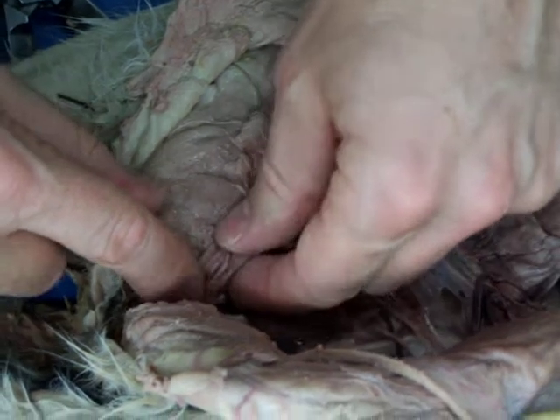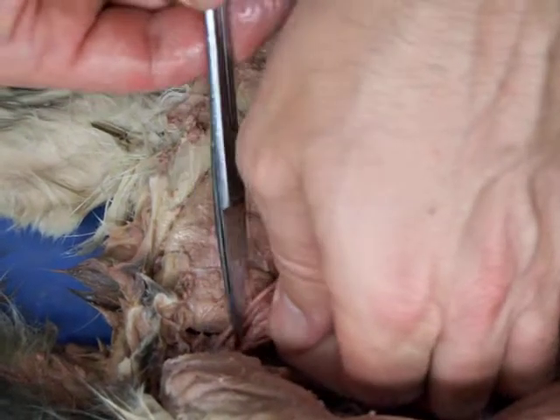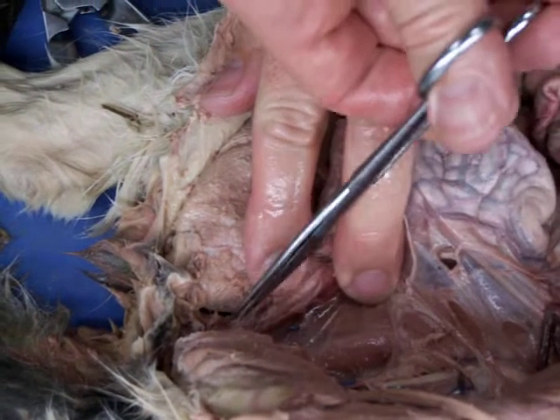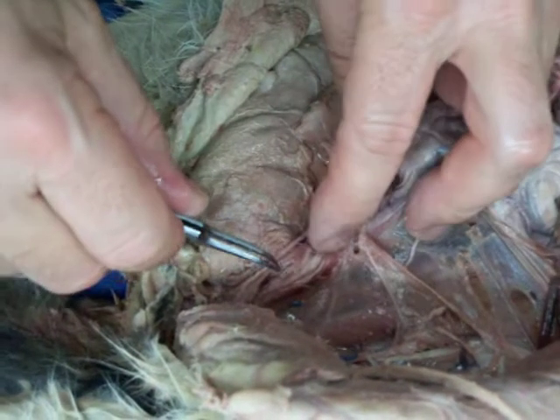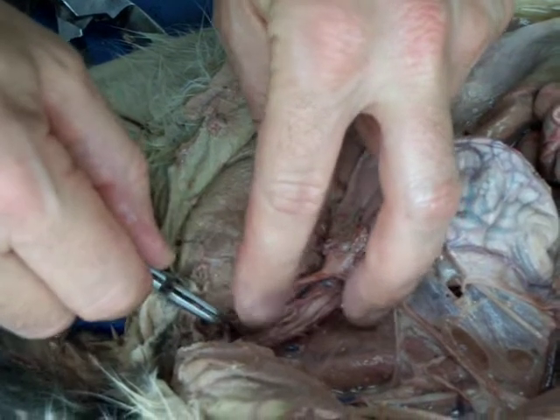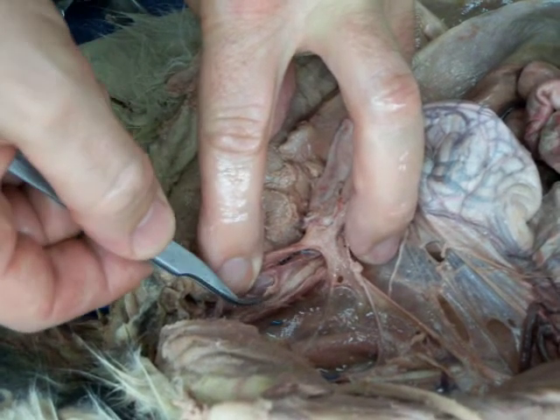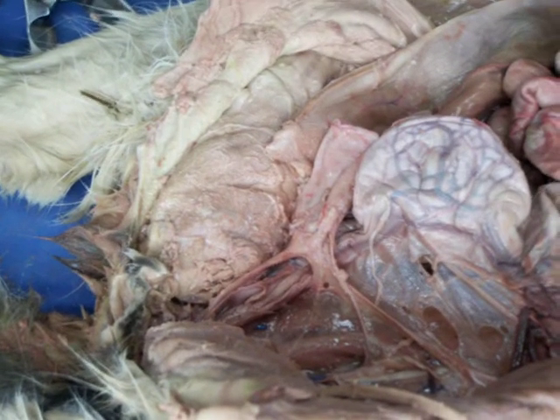Now, it looks like this is the cervix right in here. And it's just muscular folds. And unfortunately, with the cat uterus, it's not really obvious. But you can see these little muscular extensions, these folds into the lumen. And here, this is the vagina in here, and this is uterus in here. And so this right here is the cervix. And then it just forms a projection of the uterus into the proximal vagina.